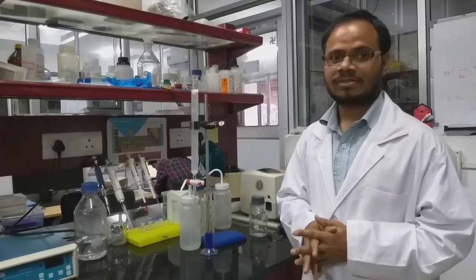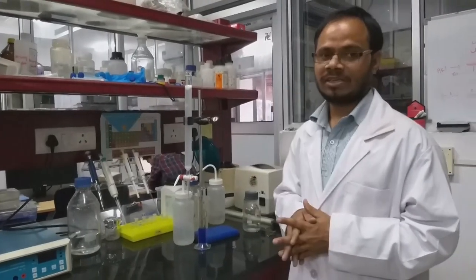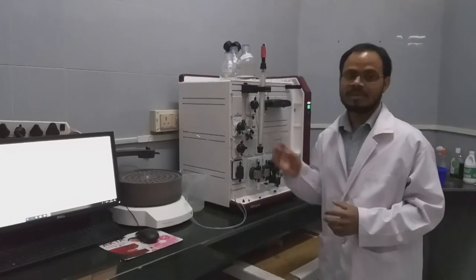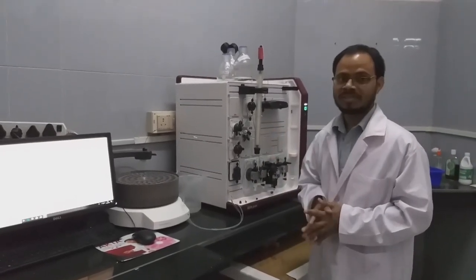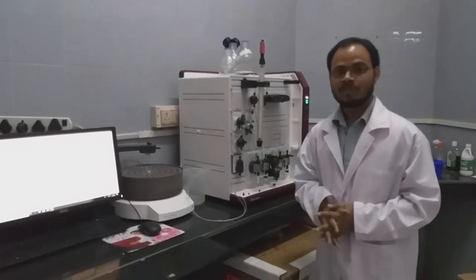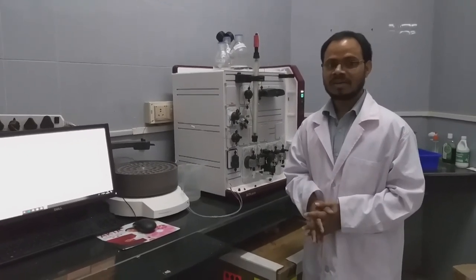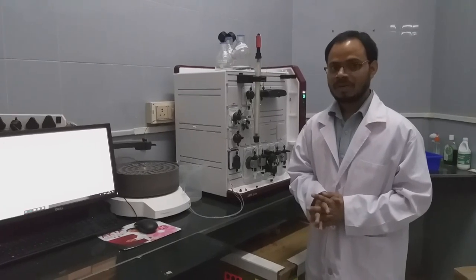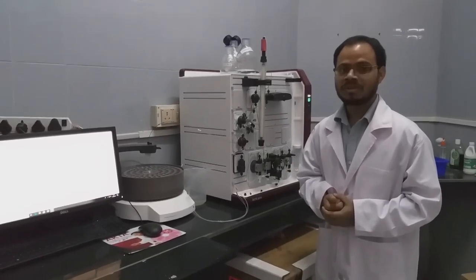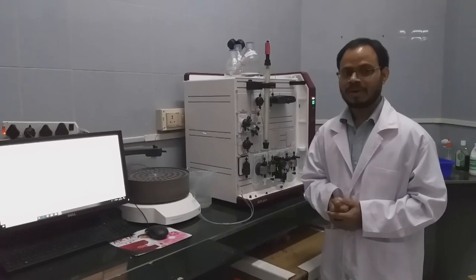This is the gel filtration column attached to a protein purification system. Here, we will inject blue dextran and BSA and show the pattern of how they are eluting. Blue dextran gives the void volume of the column, and BSA gives the actual protein with known molecular weight - we will get the calibration curve. With that, we can calculate unknown protein's molecular weight. This column is equilibrated - we removed the 20% ethanol and water. The blue line corresponds to 280 nm, which is relevant to protein. We can see there is an initial spike, but gradually the curve flattens out, which means there are no contaminants and the column is ready to inject protein.